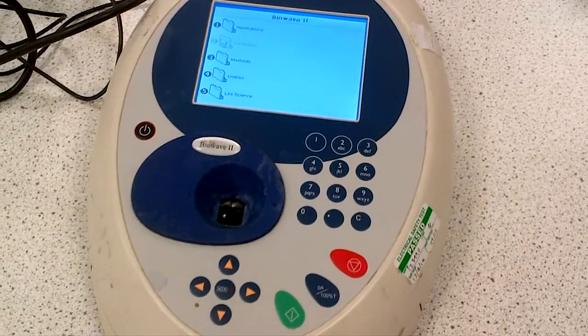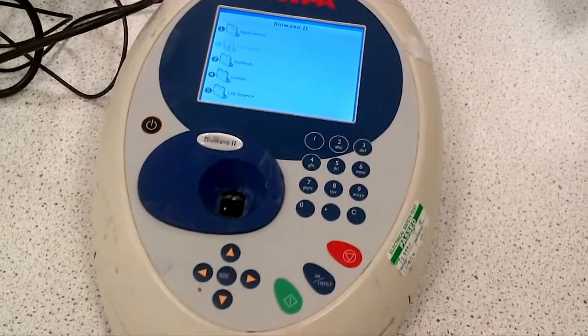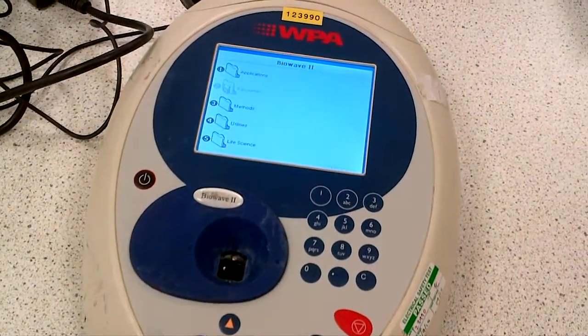Alright, so in this quick video demonstration, this is how to use the UV spectrophotometers which are currently in the lab here at Salford.